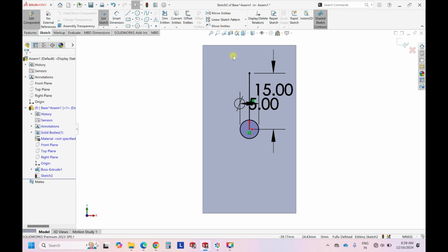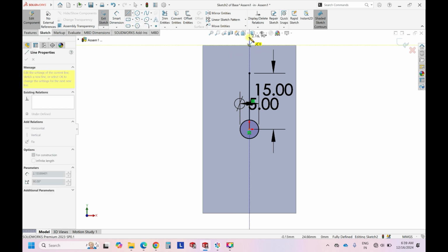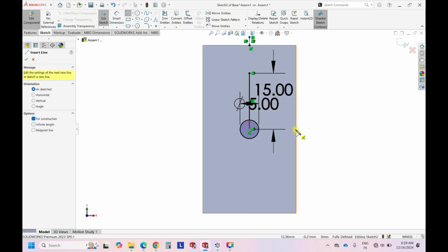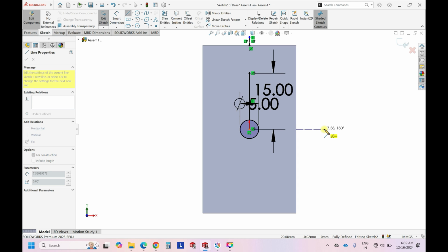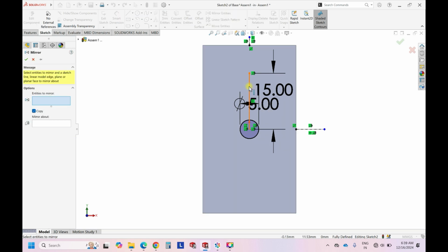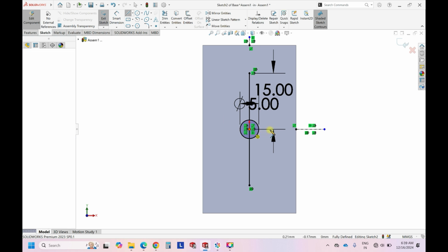Then we'll have the center lines. So this helps us in mirroring the entities. Okay, so now let's mirror the same way. This be over this, and similarly we can design another line.